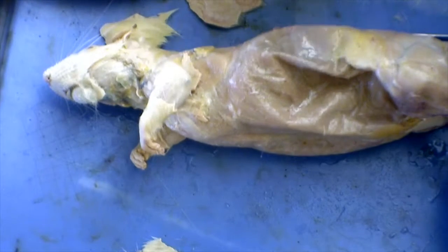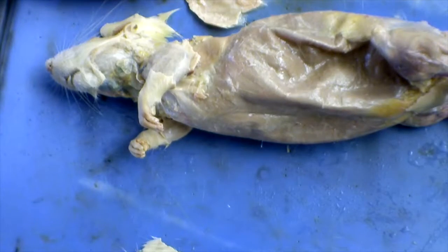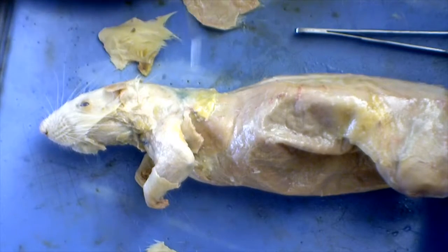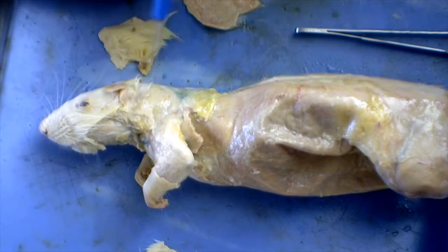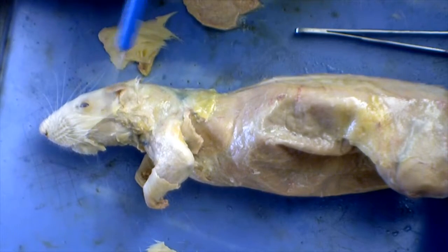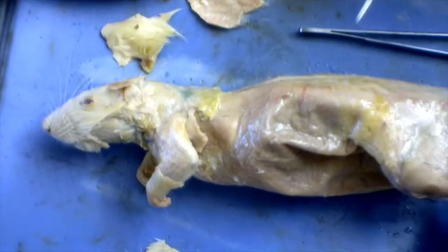They kind of look like ribs. Here we have the external obliques. If you cut those open, you can get to the internal obliques, which are located directly underneath them. It's kind of like the second layer. Up here, you can see the eye, obviously, and then there's the masseter on the side of the face, and the clavotrapezius and the acromiotrapezius located in the neck, which help to give the shape to the rat's neck and again to help it move.